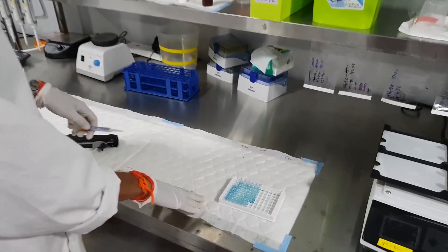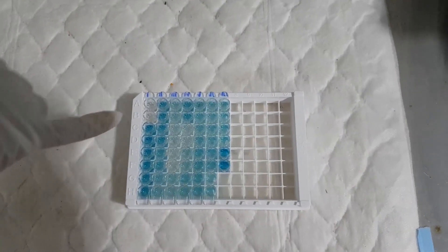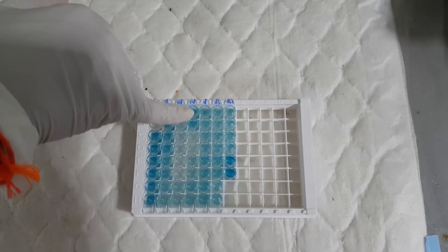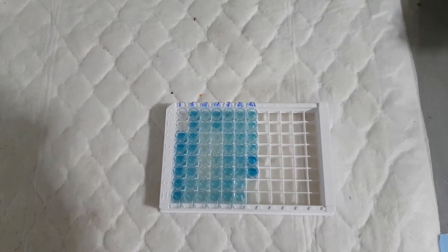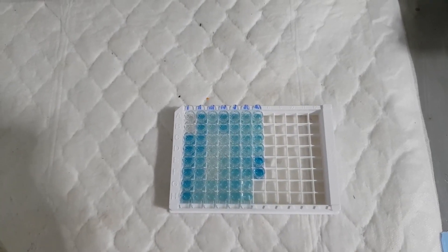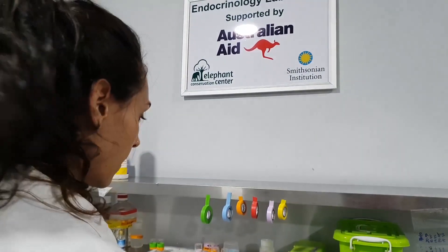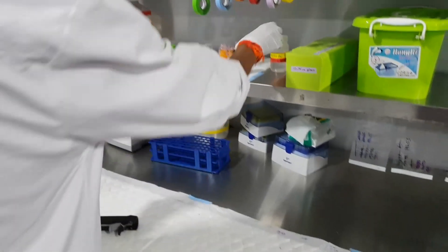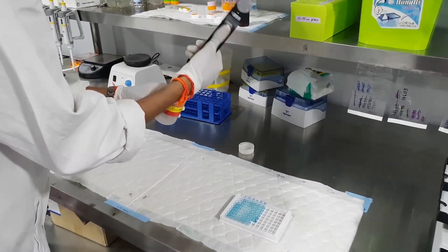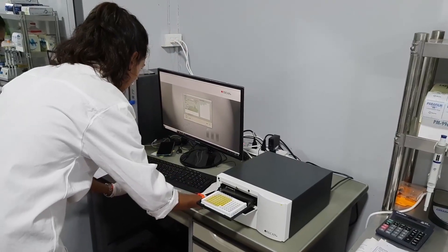So now it's already been a half an hour incubation, and we can see that the blue color has developed. What we can see is that the last sample of Mechamon — the blood that we collected today — is kind of the same color as all the samples that we picked from previous baselines. So just by observing the plate, it kind of tells us that this is really in baseline, and we confirm by comparing with other baseline values. Now we're going to stop the incubation and use the plate reader, and the machine is going to tell us exactly the concentration of each well. The reaction is moving, so we have to read the plate as fast as possible.